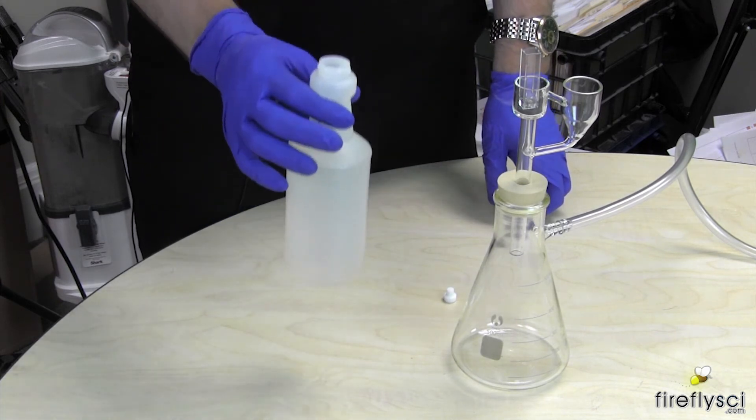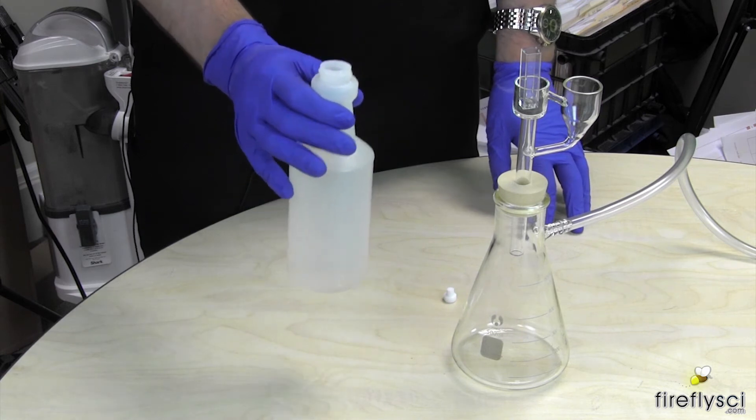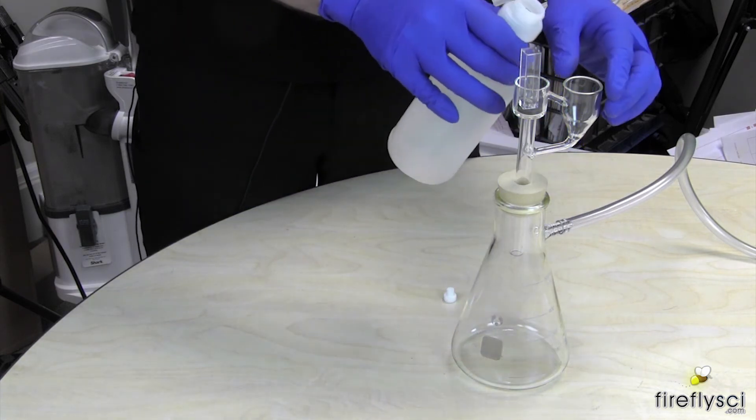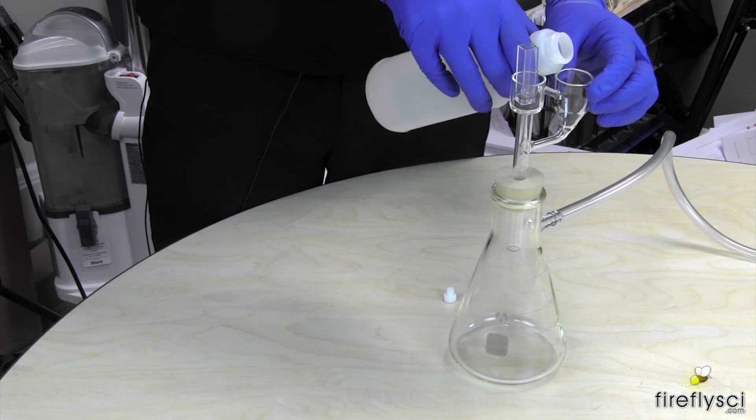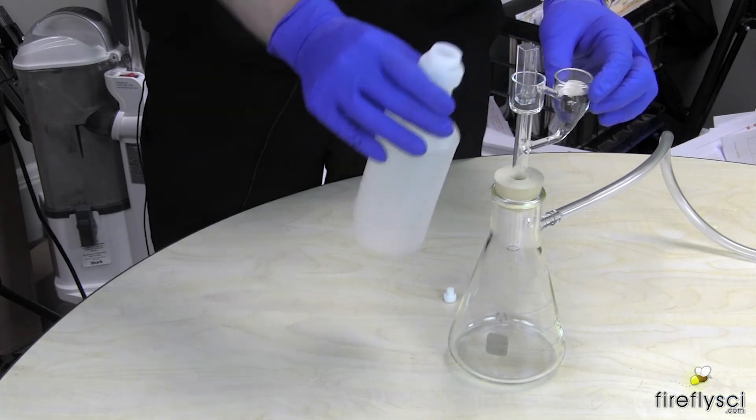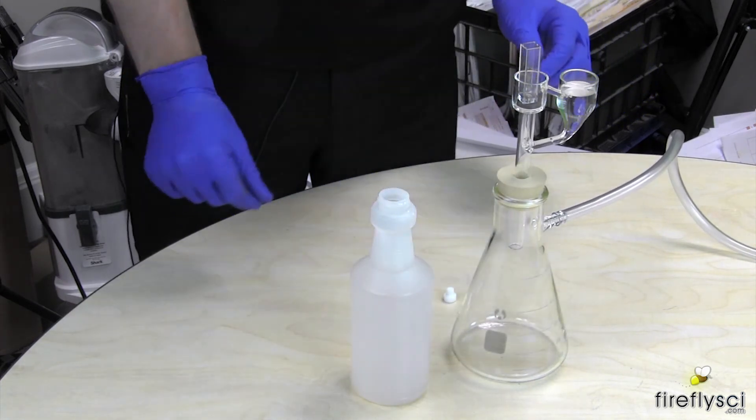And I have my high-tech cleaning solution here, just some water. Again, you can use whatever cleaning solution you want. I'm going to put it right in the cup here, where the solution goes. And I'm going to put on the vacuum pump.